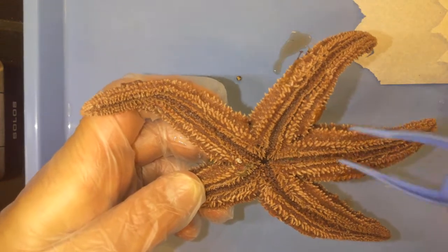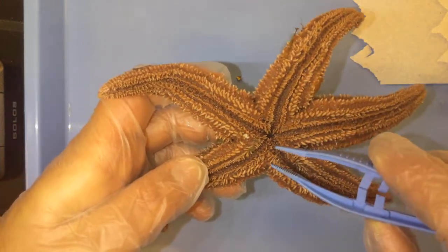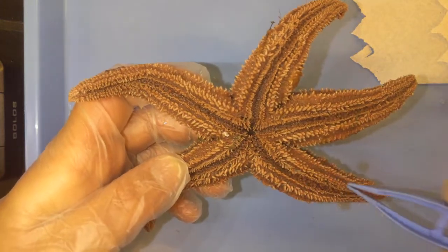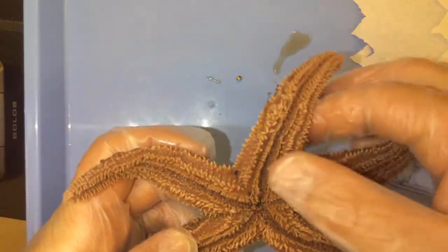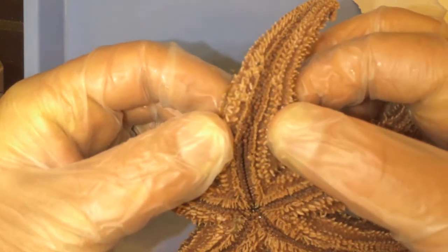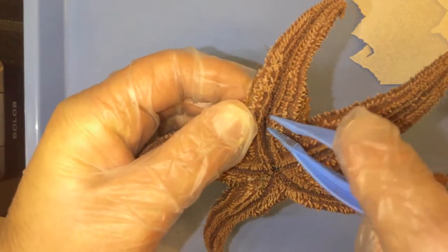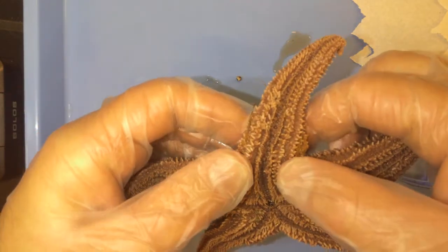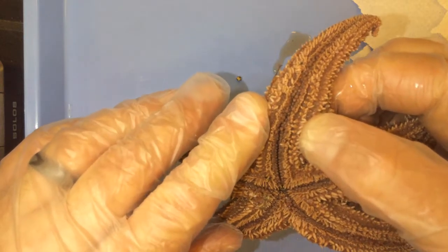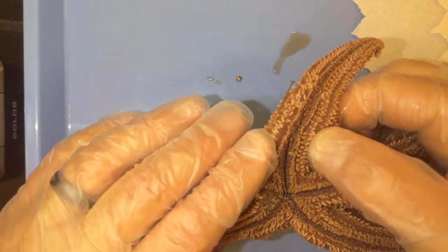Radiating out from the central disk under each arm are the ambulacral grooves. These grooves are where all the tube feet sit in. So these are all the tube feet sitting in the ambulacral grooves. These tube feet not only help the sea star to crawl across the sea floor, but also help it to grasp and hold its prey for feeding.